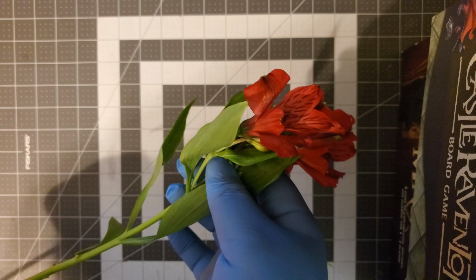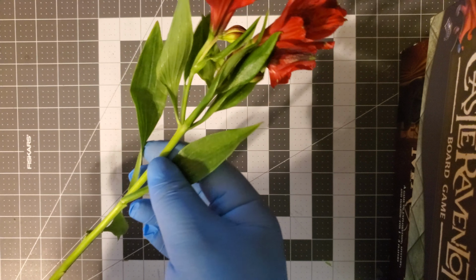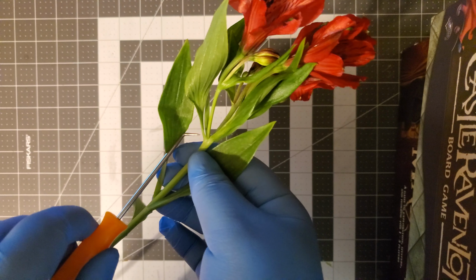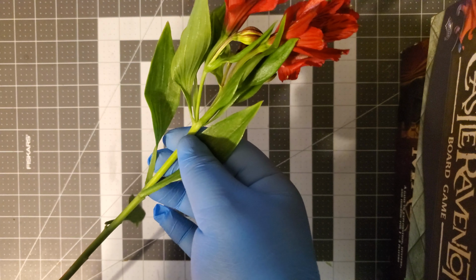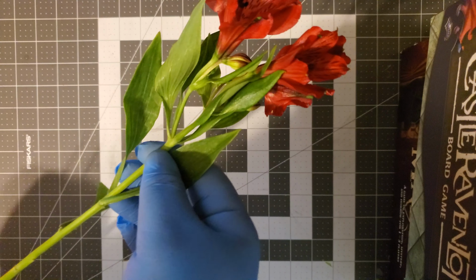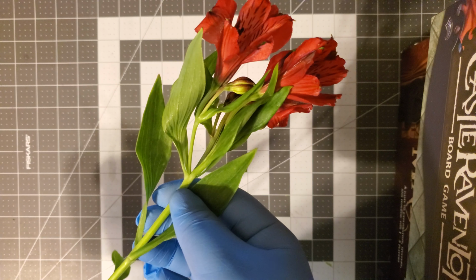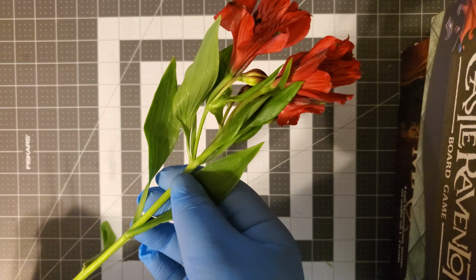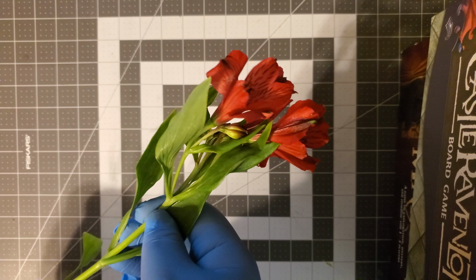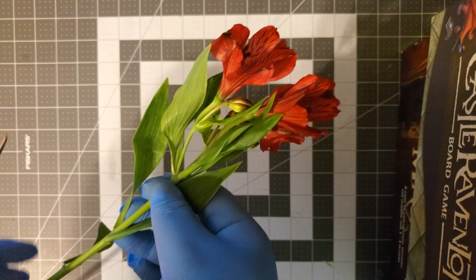So, let's just start simply with the peduncle, or the stalk of the flower. There's not much to say about it except that there it is. It's just supporting all these flowers. Since it's supporting not just one flower, the peduncle is supporting an inflorescence, a term just meaning group of flowers. We're going to work our way up and reach the receptacle.